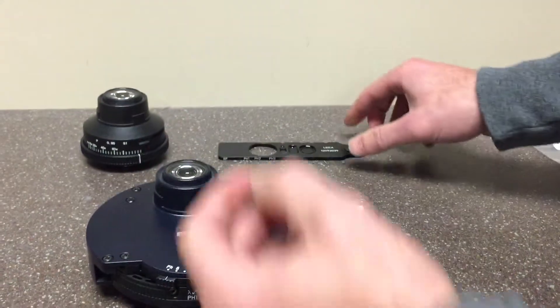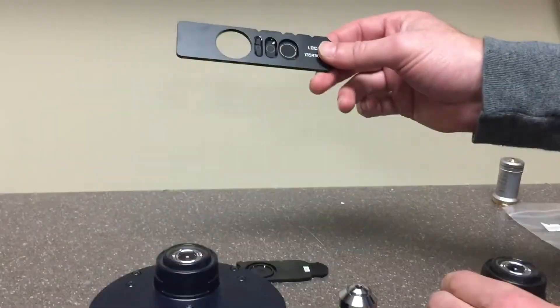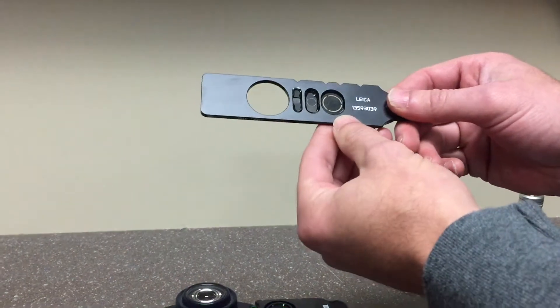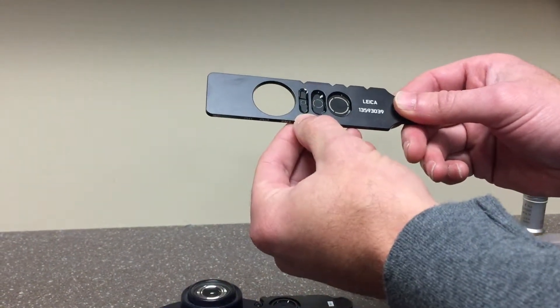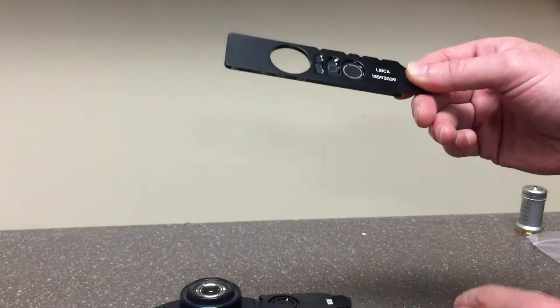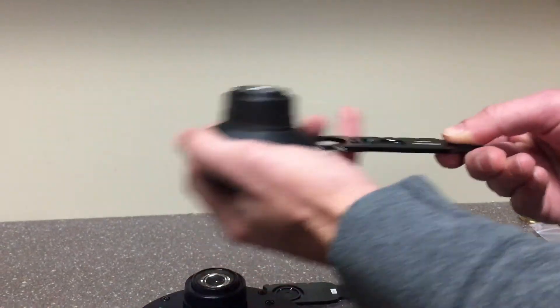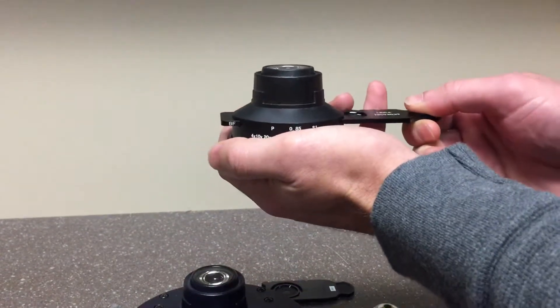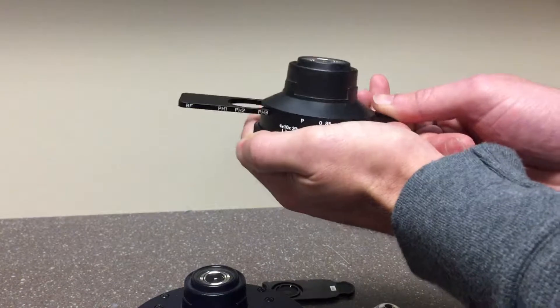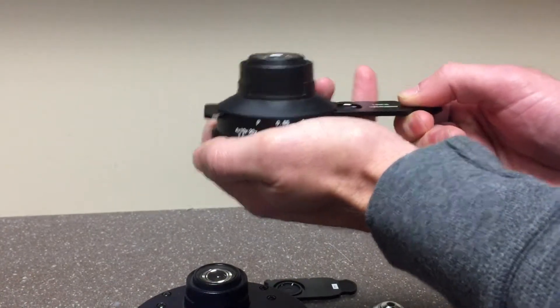The second method is with a phase contrast slider. The phase slider will have the three annulus on the bar, as well as a bright field position. You insert this into the condenser and push or pull to match the annulus to the objective that you have selected.